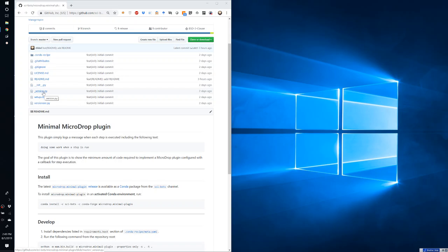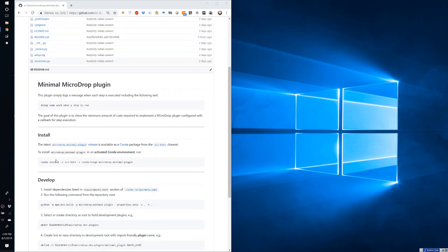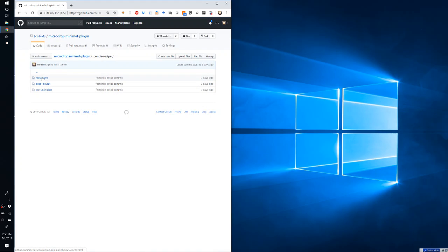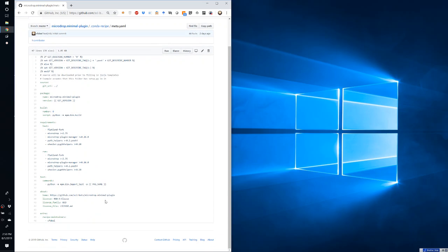version of a plugin using git tags, a README file, which you can see the contents here, that includes installation instructions and instructions on how to develop the plugin while you're using an installed version of Microdrop. It also includes a license file, and finally the recipe file for Conda to build the plugin into a package that can be installed using the Conda package manager.